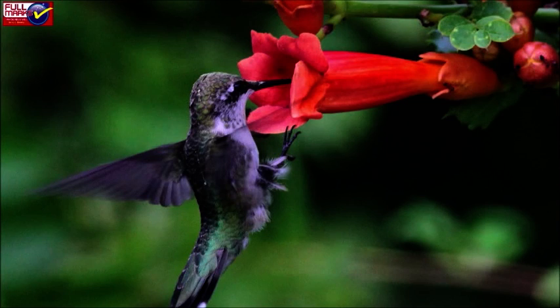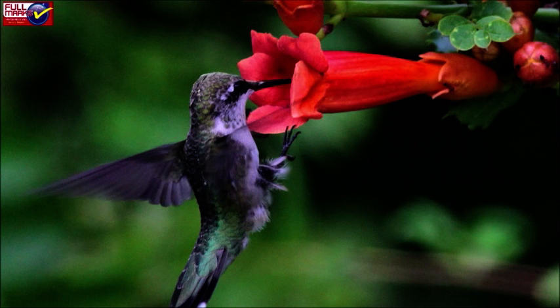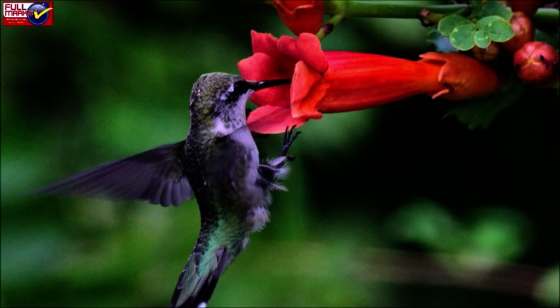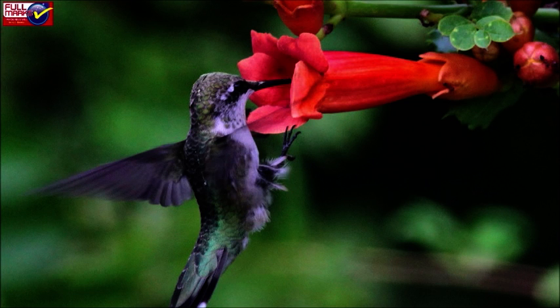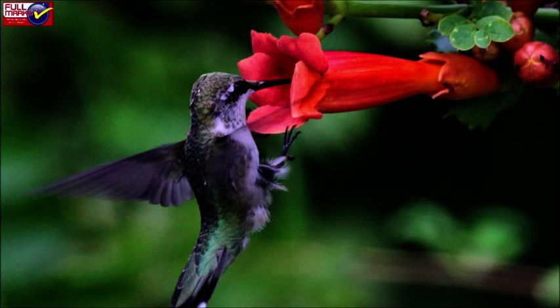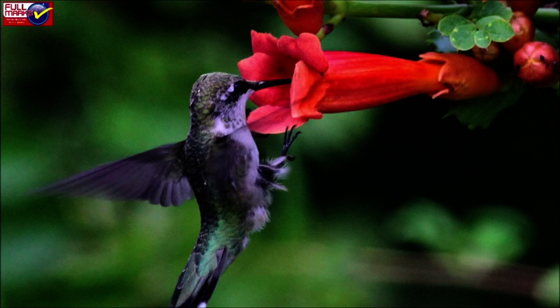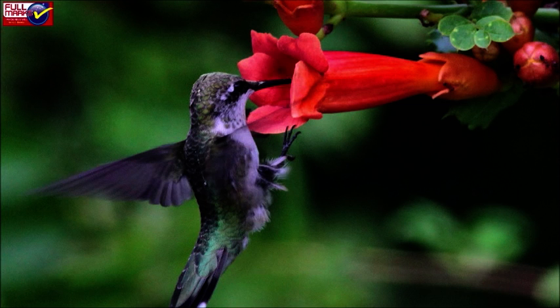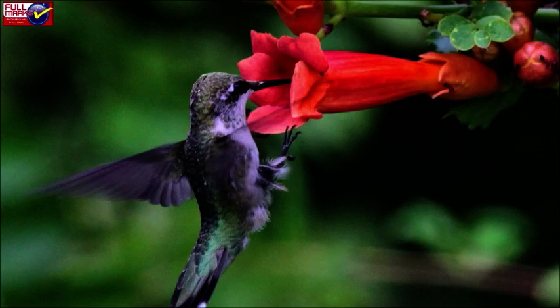Observations: The flowers are big, odorless and brightly colored — red, yellow and orange. The flowers are thick and leathery. The flowers produce abundant watery nectar. Result: Adaptations of flowers pollinated by birds have been studied.